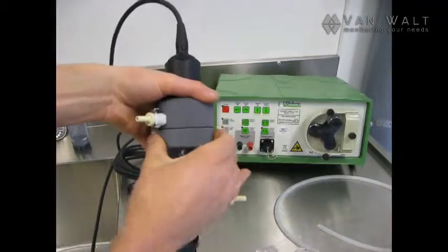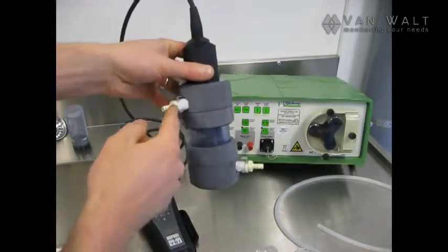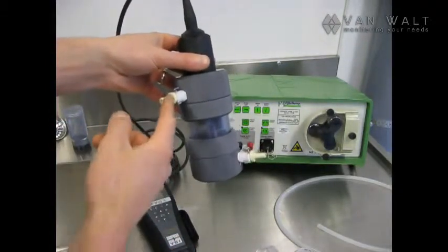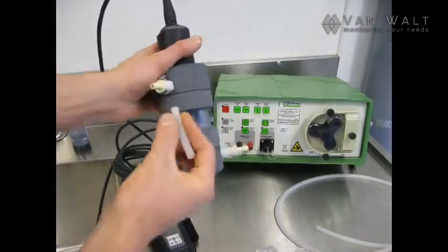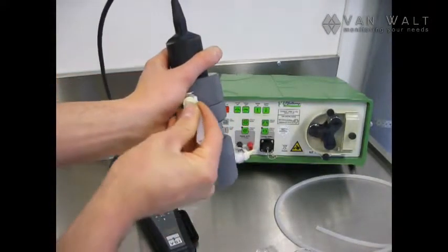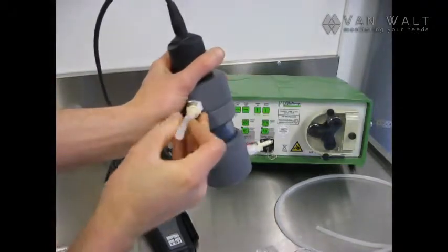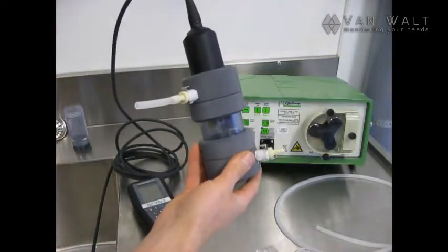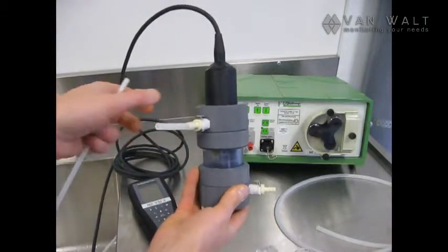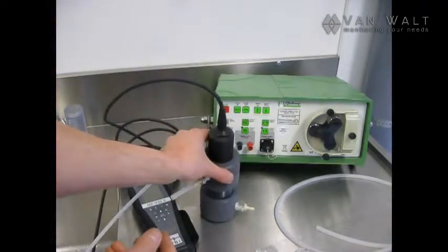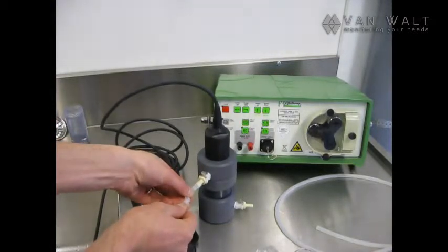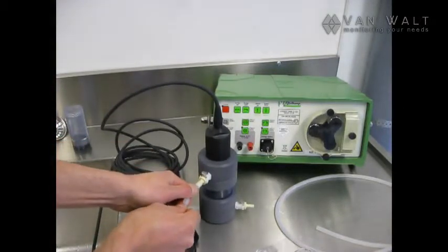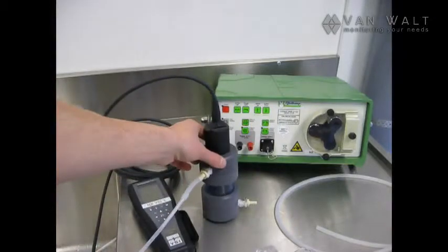Now what I'm going to do is have a look at my discharge tube here. I've cut myself a small piece of silicon tube. I'm going to fit that over here. And now a little bit of PE tube. And there we go, that part's ready there.